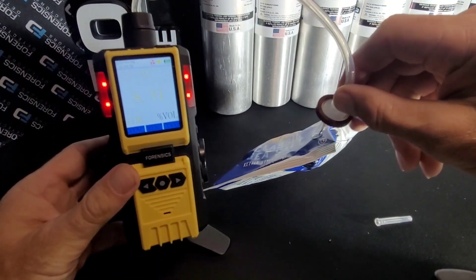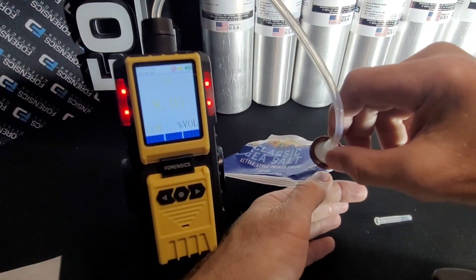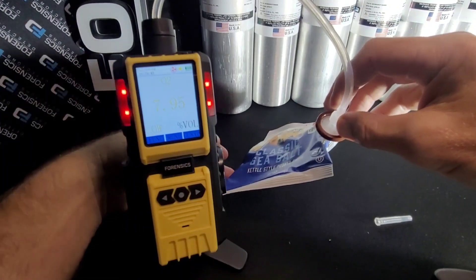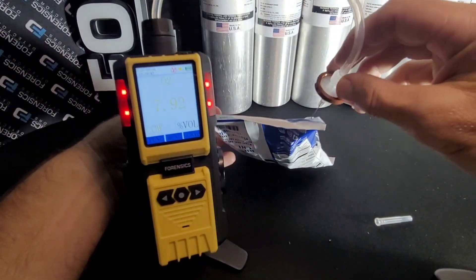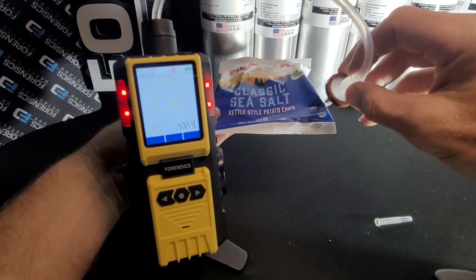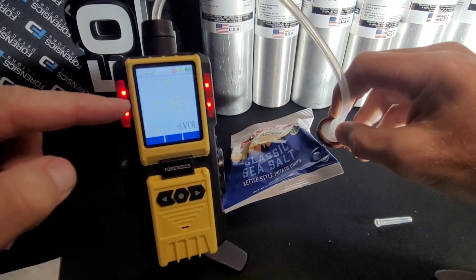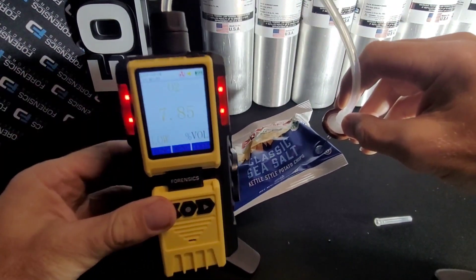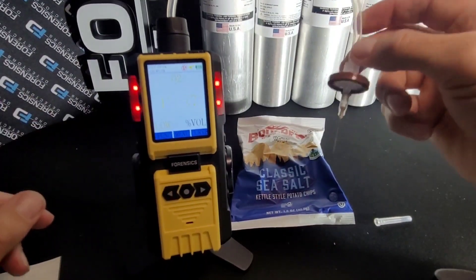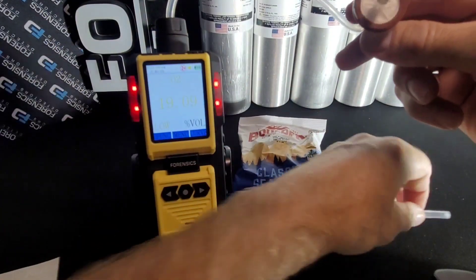We can see the numbers going down, and it looks like it's a fair flush. Make sure you have at least 200 mils of volume in your package. You can see the package here is shrinking — it's pretty much taken up all the gas. We've confirmed there was a nitrogen flush, just under 8%. The numbers have stabilized to 7.85. Once you're done, it should come back to 20.9. The measurement should take about 60 seconds, no more.